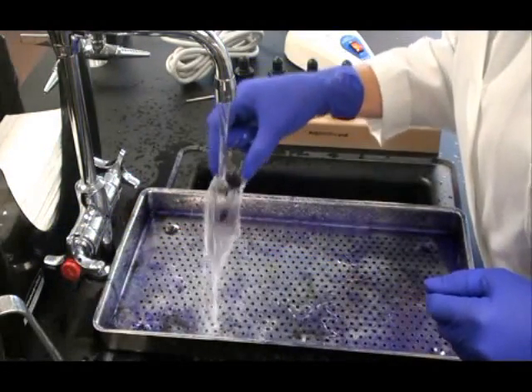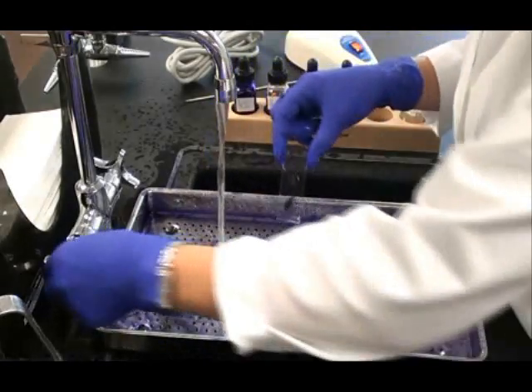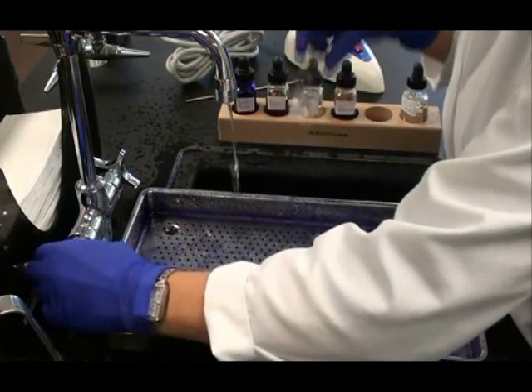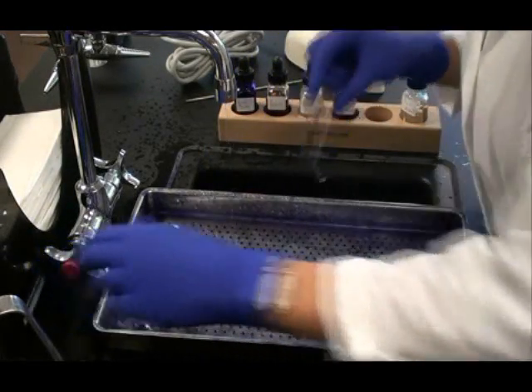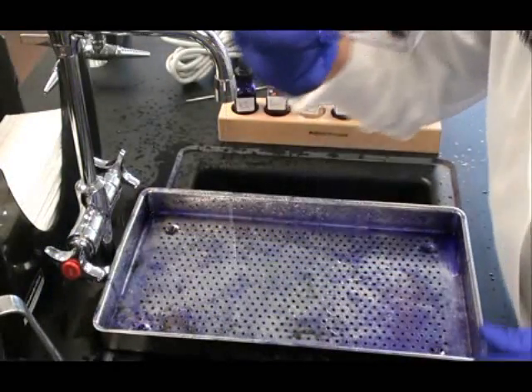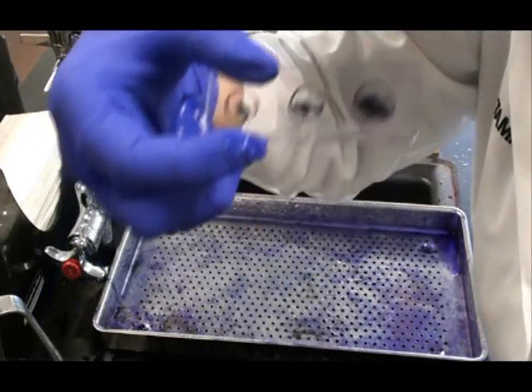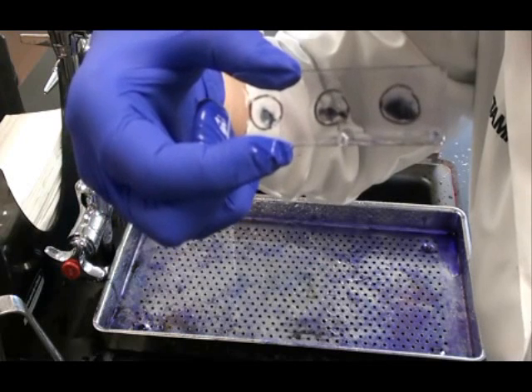After waiting one minute I rinse the Iodine off my slide. If you take a look at that slide now, the three circles look a little darker, a little bit darker purple.